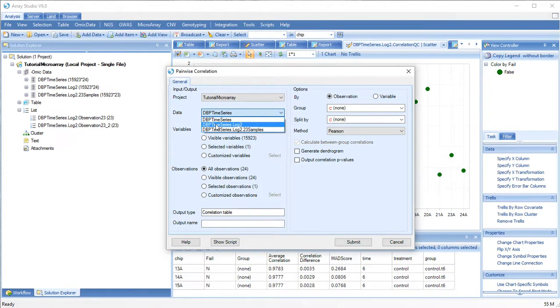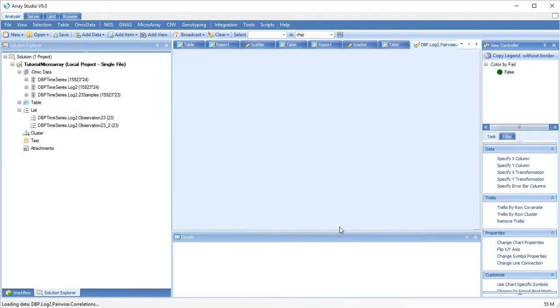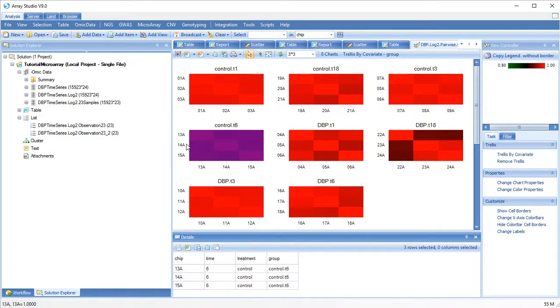Choose your source data, output name, whether you want to group your samples in the display, and whether to calculate the comparisons, the correlations between groups. Again, the correlation of chip 22A compared to its replicates is much lower than with other chips in a set. If you don't specify a grouping, all pairwise comparisons will be made.